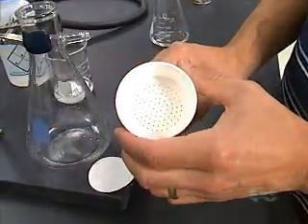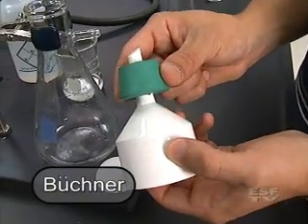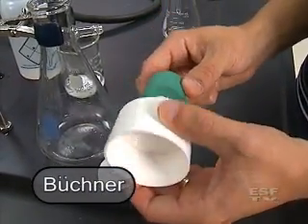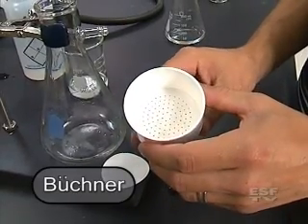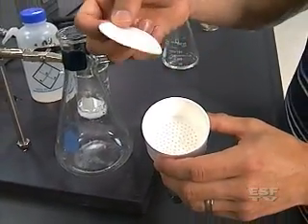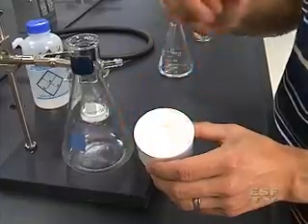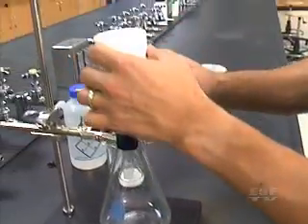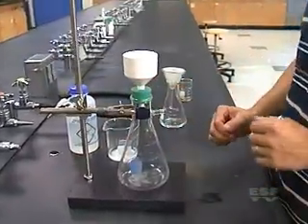In this case instead of just a regular glass funnel we have what's known as a Buchner funnel. On the bottom we have a rubber stopper to form an airtight seal, and then at the top we have a bunch of holes that are going to let the solution pass through it. And then we have a piece of filter paper which we're just going to stick on top of the filter. We don't need to fold it in this instance. I'm going to put my filter funnel and filter together onto the filter flask.